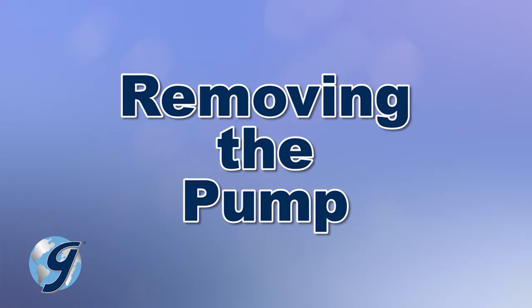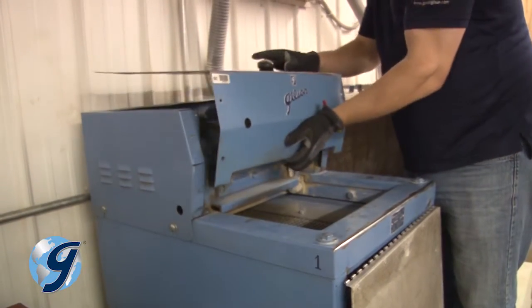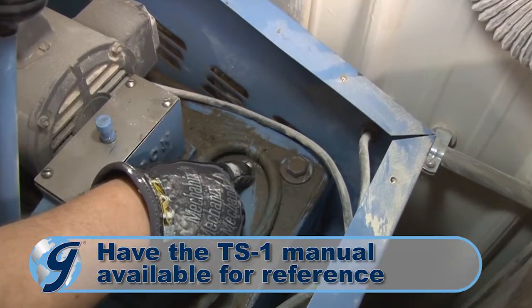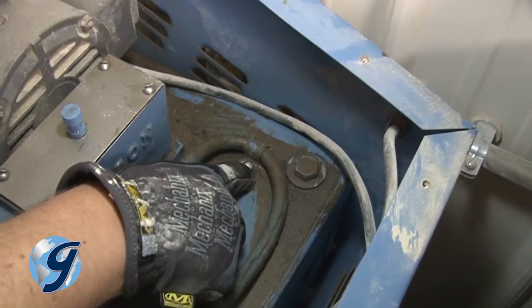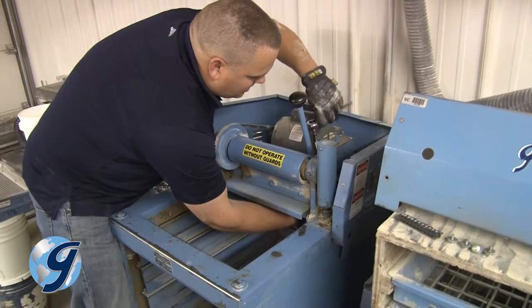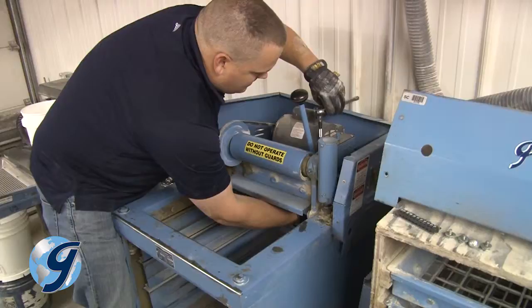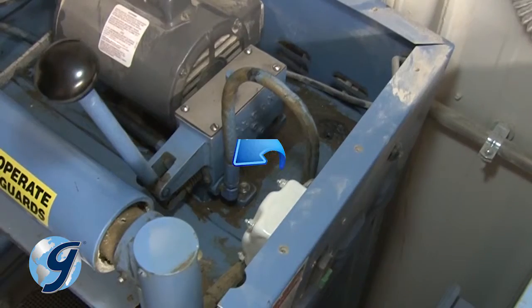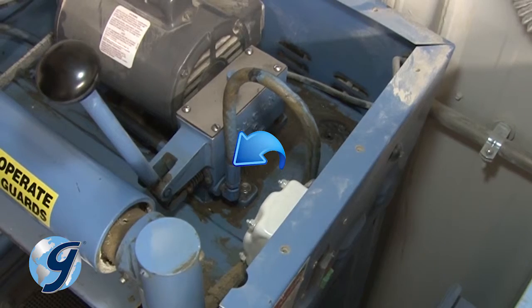At this point, we've unplugged the testing screen, removed the top cover, unfastened the side cover, and removed the screen trays. Now, remove the clips holding the hydraulic lines. Next, unfasten the 3 bolts that hold the pump in place. To gain access to the rightmost bolt, rotate the 90-degree hydraulic fitting up.